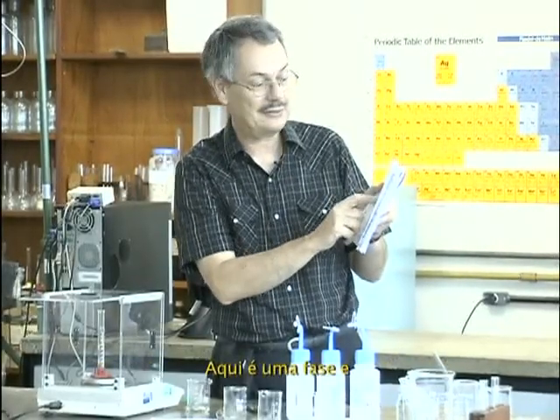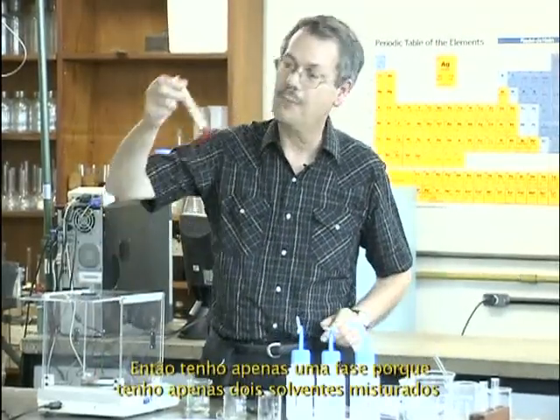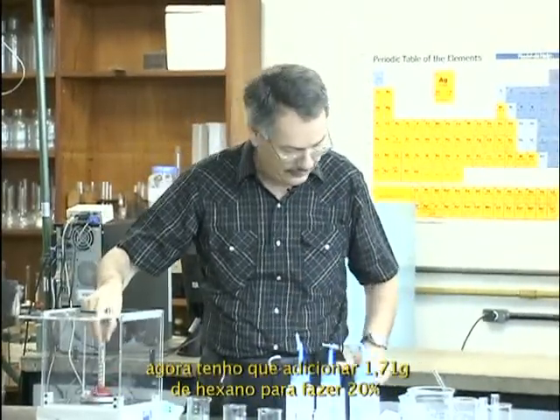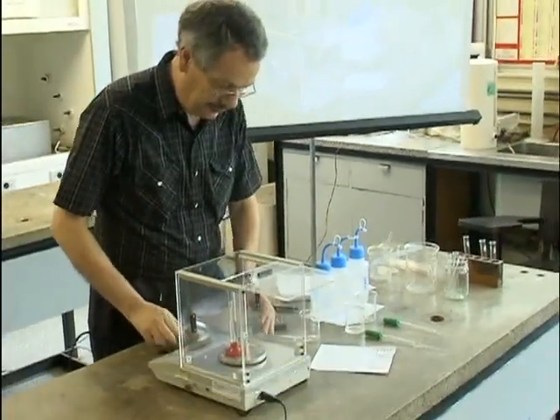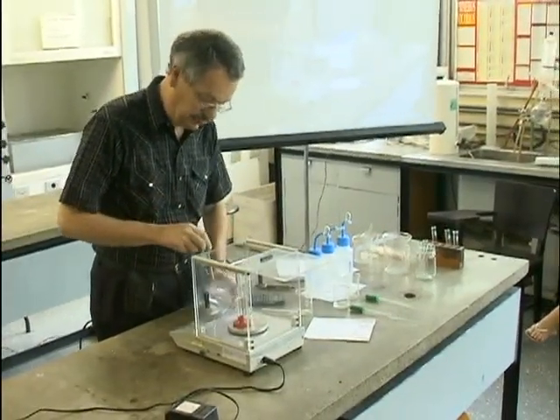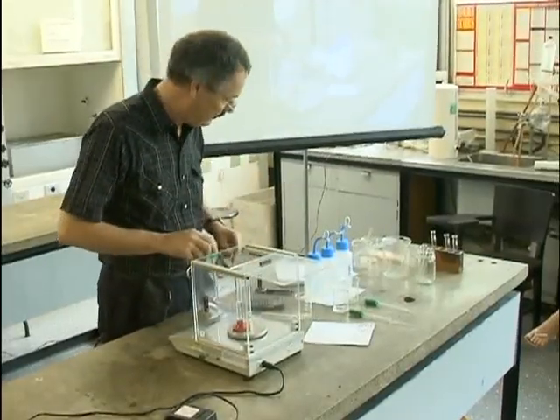This is one phase, this is two phases. So I have one phase now because I have just two solvents mixed. Now I have to add 1.71 gram of hexane to make 20%. I forgot the 0, it's 1.71 gram.